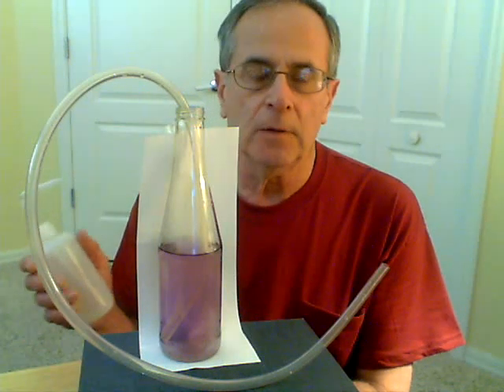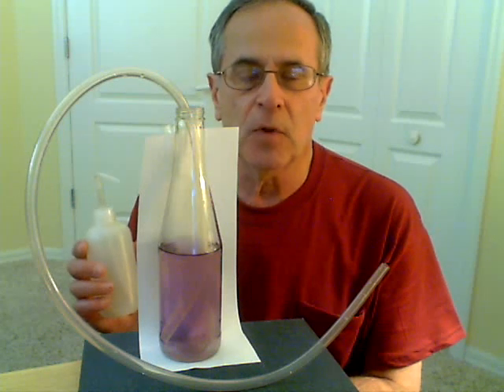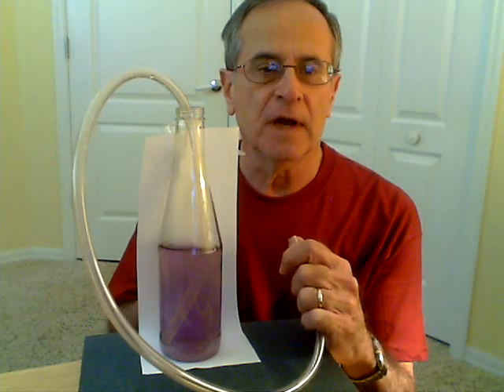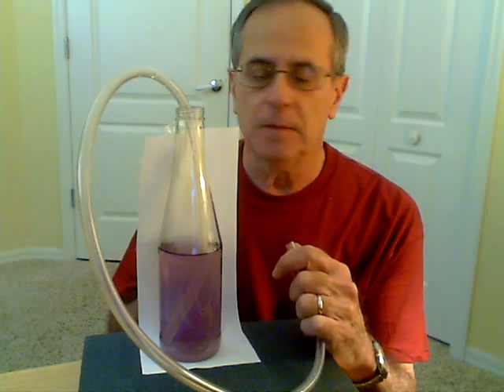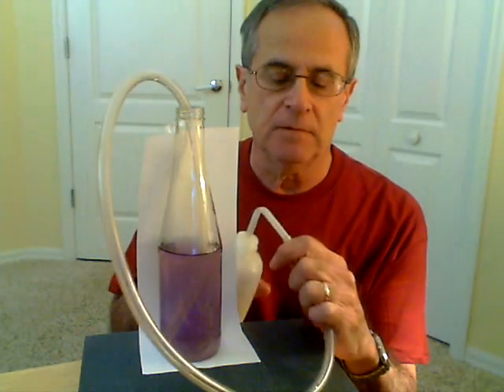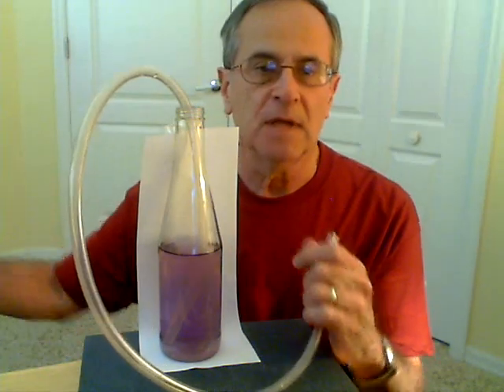Regular air has a very small amount of carbon dioxide, less than 400 parts per million, or 0.04%. First I'm going to demonstrate that regular air does not have an effect — there's not enough carbon dioxide in it. So I'm just squeezing air into the tube and into the bottle. I could do this for a long period of time, but I'll ask you to trust me that it does not cause the solution to become acidic.